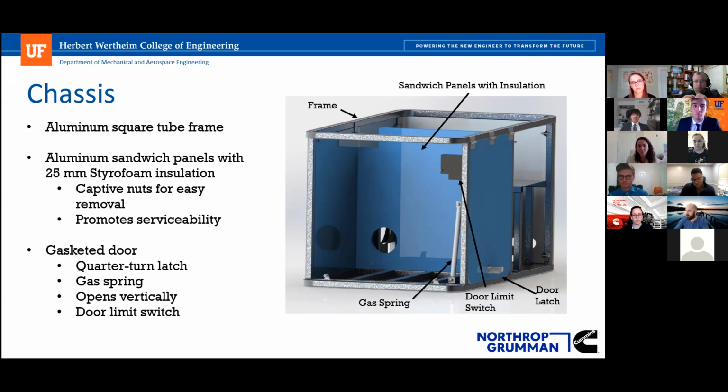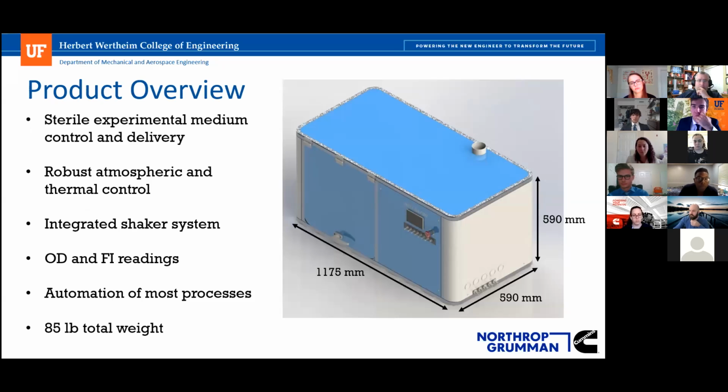Yeah, so not shown in this picture is the top panel, obviously, and then there's a bottom panel. So you can see that the box beams don't actually really come into contact with the culture environment. It's a perfect box of styrofoam, and then only on the very corners is the box beam corner. Okay.